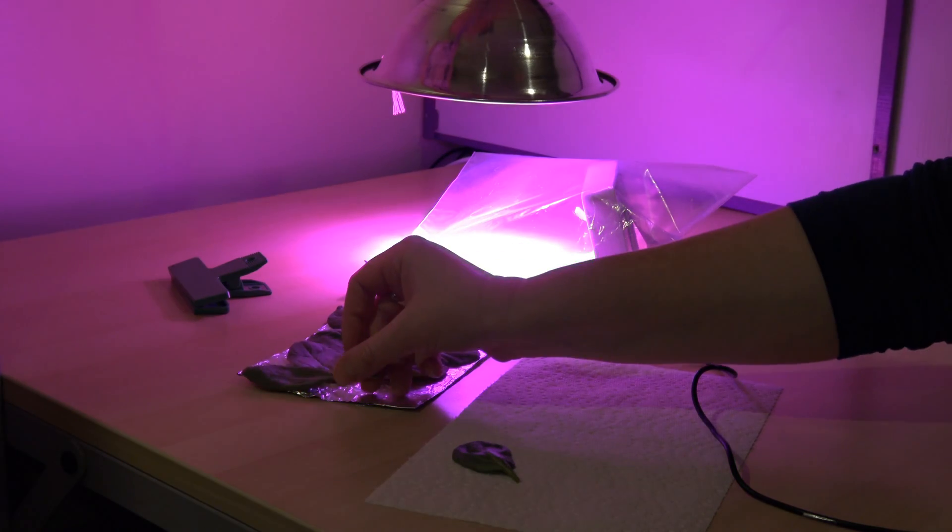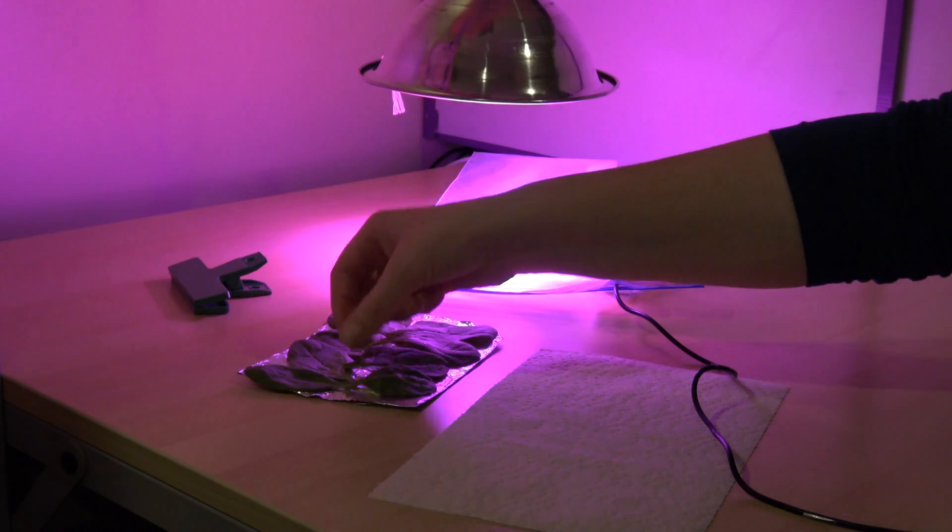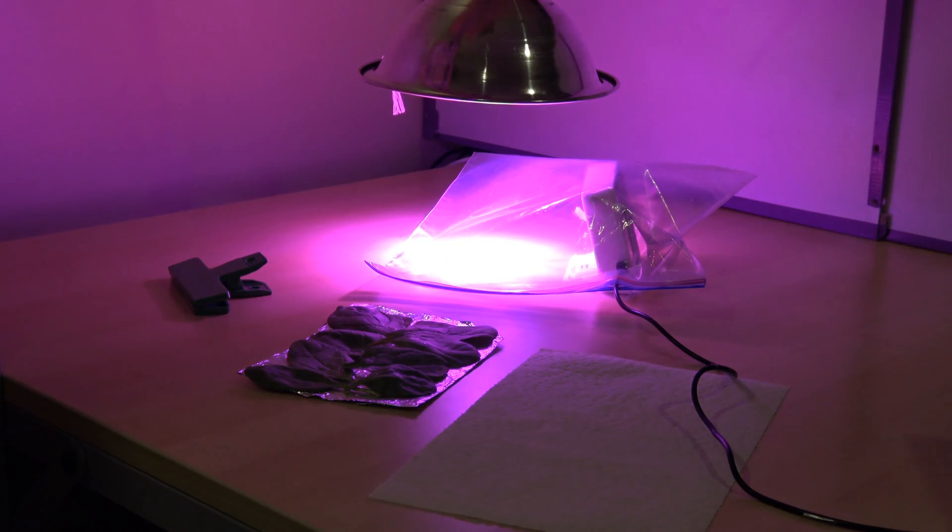So now I'm just going to finish laying these leaves on here and voila, my leaves are ready to go.